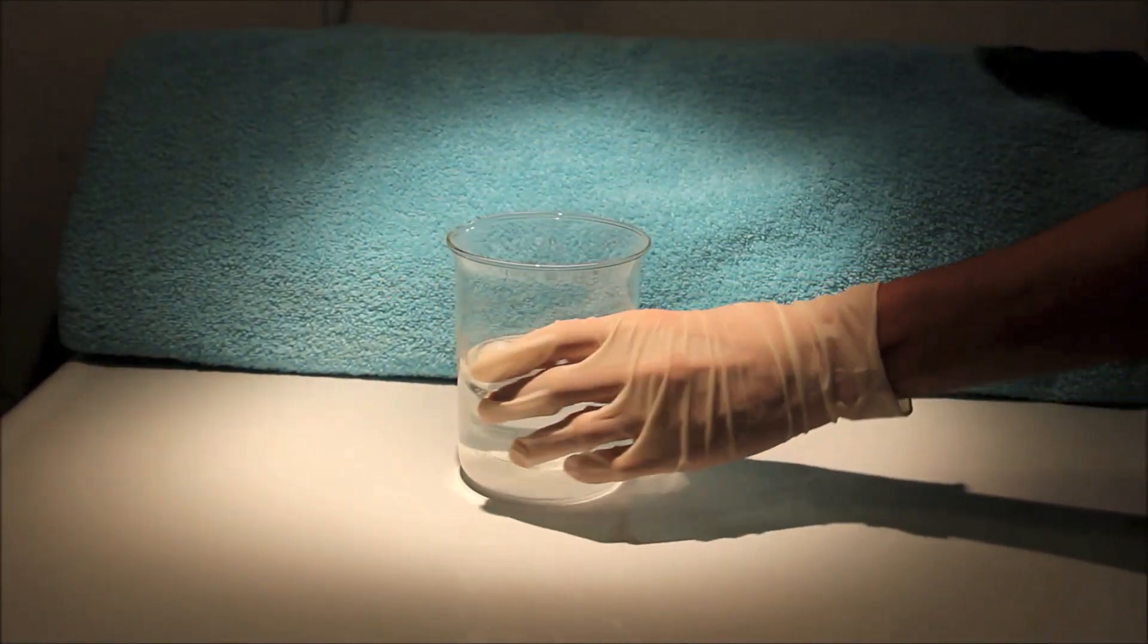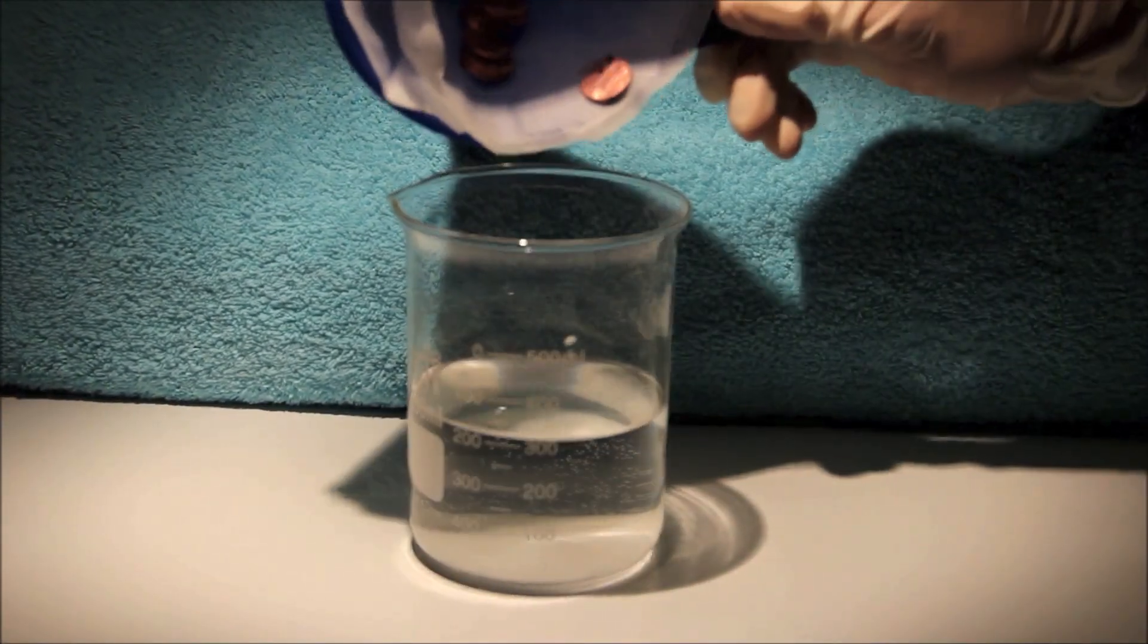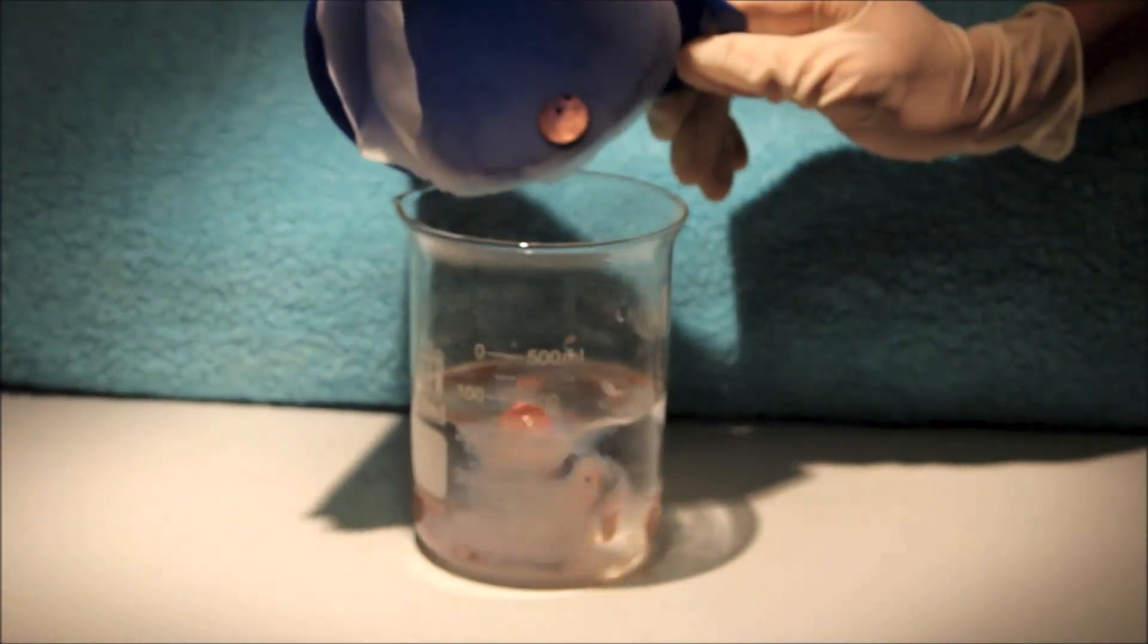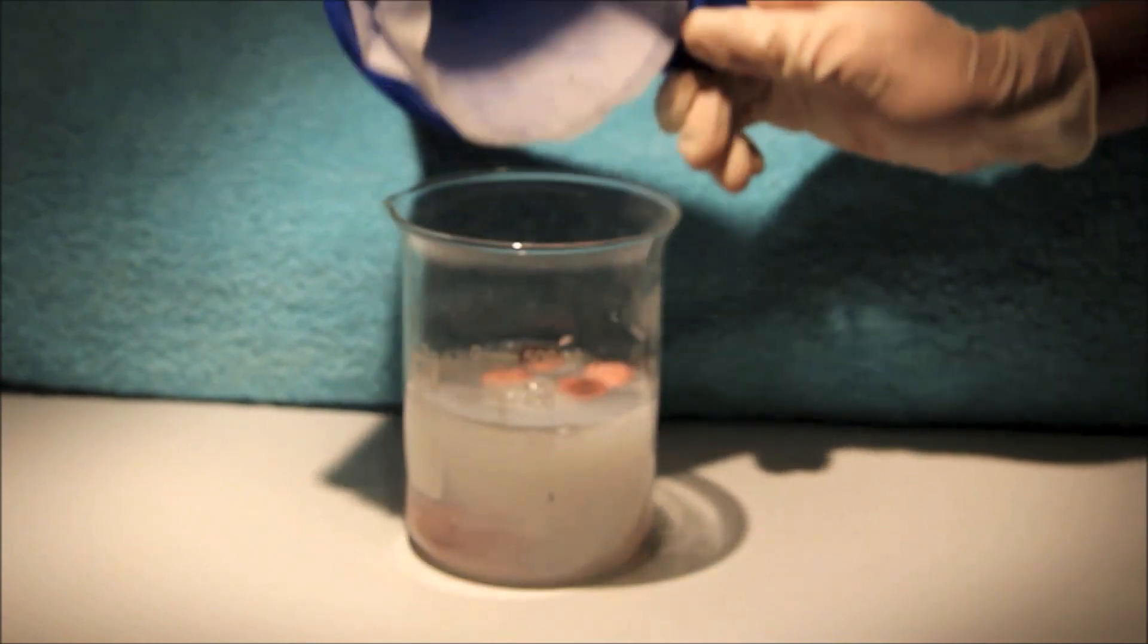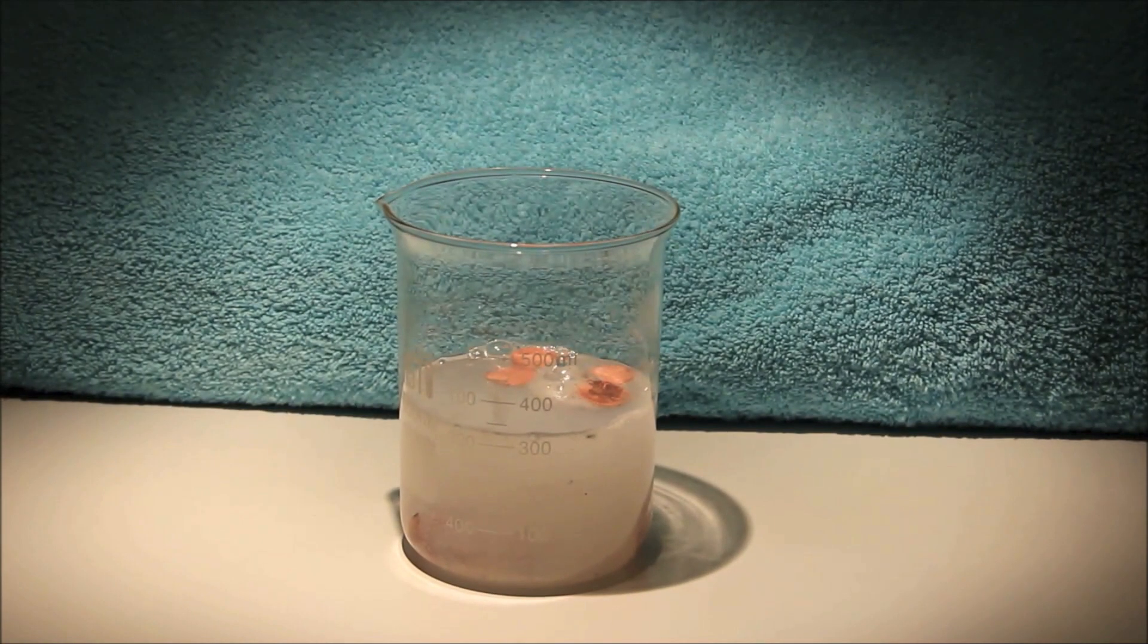Here I have a solution of sodium hydrogen carbonate, commonly known as baking soda. I'm going to add the pennies to the solution, and the sodium hydrogen carbonate will react with excess hydrochloric acid and zinc chloride solution left over on the pennies.